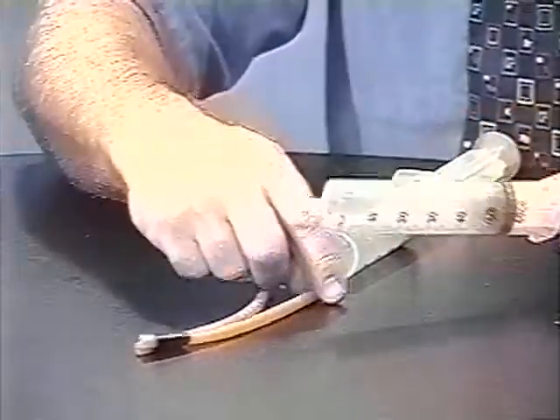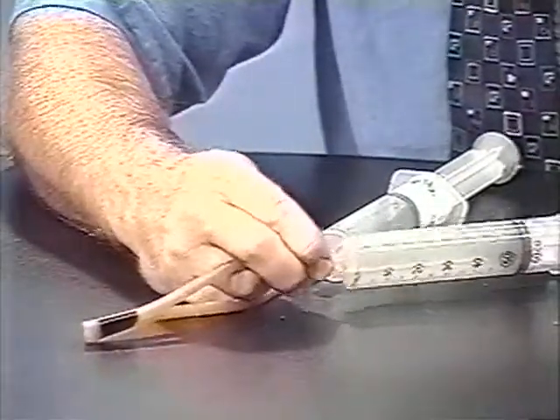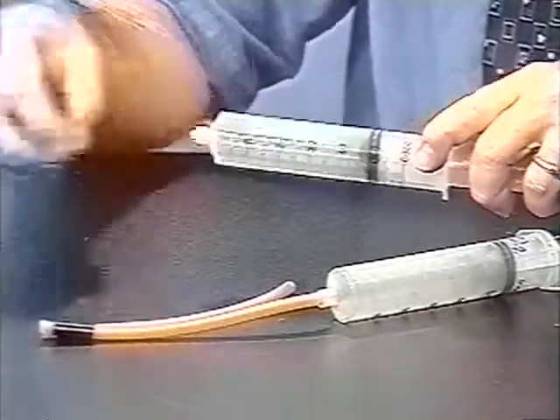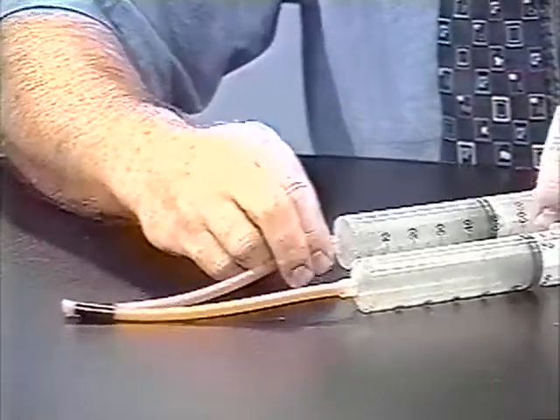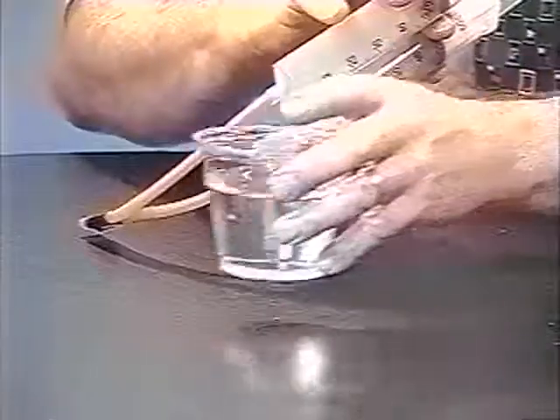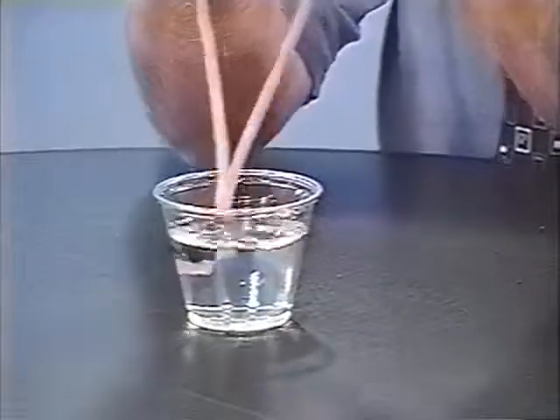There was a little bit of a hiss — that was air running in. That's not a problem. Acetylene also smells a little odd, so I'll do the same for it. And now I've got both gases connected to the latex tubing, and I can discharge them simultaneously underwater.